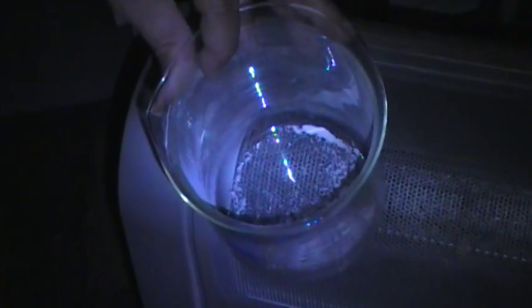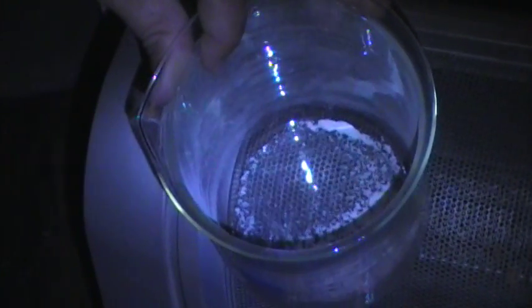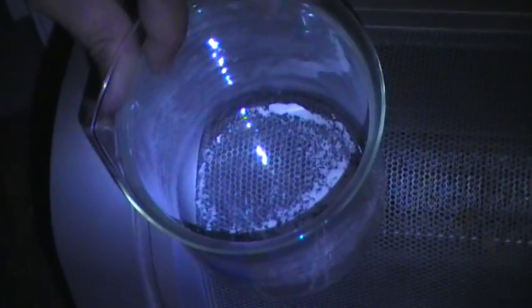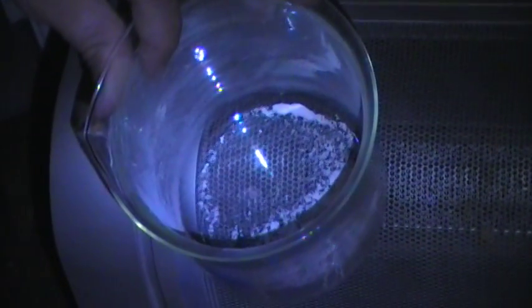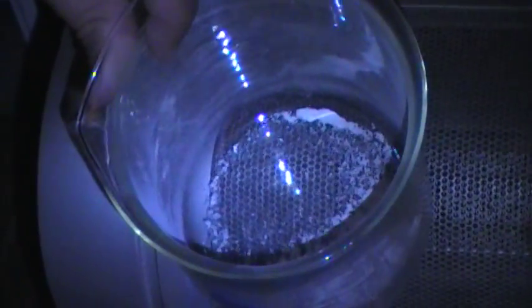This is performed using a dry lye boil on azomite minerals for approximately four hours, and the solution was brought down to a pH of 8.5, and I got a white precipitate which I air-dried.